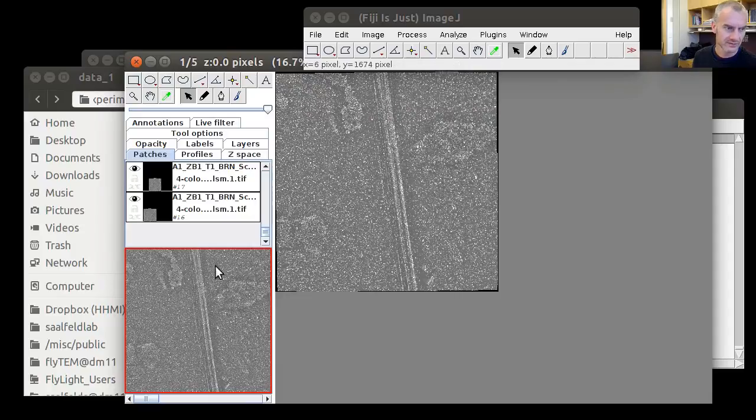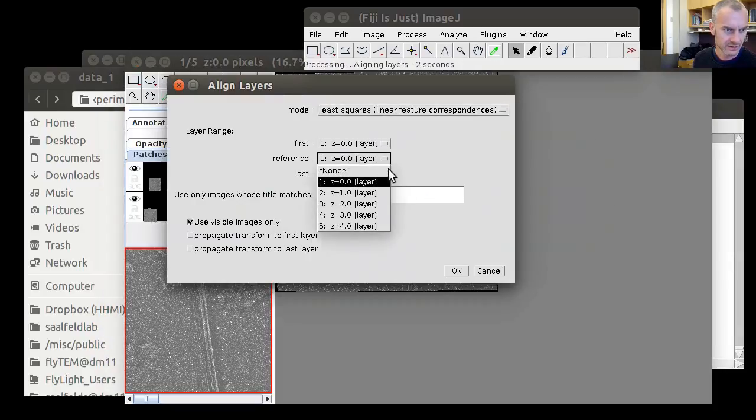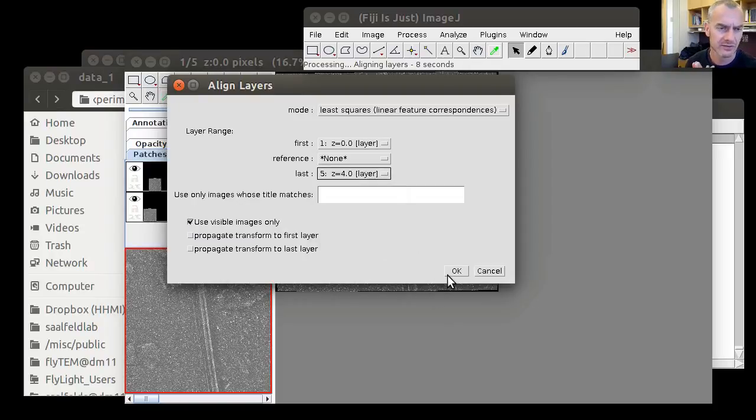Alright, so once this is finished, we've seen earlier that we have to align these layers, and this time we do it with an affine transformation, because the independent lens corrections that TrakEM2 estimated rectify all these images up to an unknown affine transformation. So if there is a bias in the images, like the channels are either translated relative to each other, or rotated, or sheared, or scaled, that would not have been accounted for.